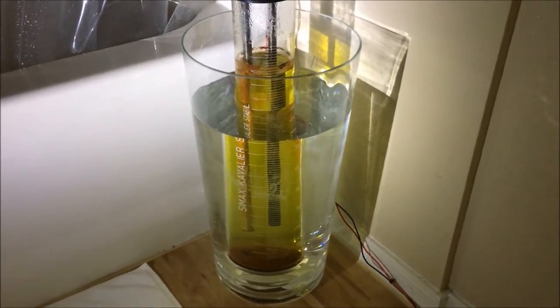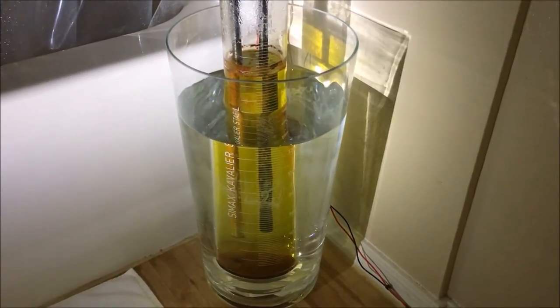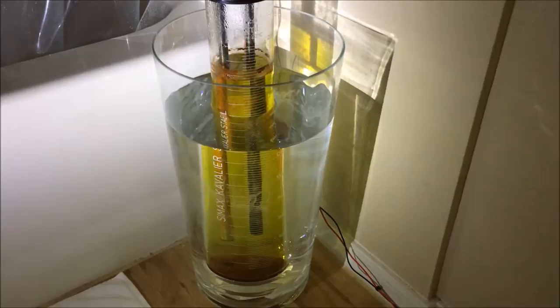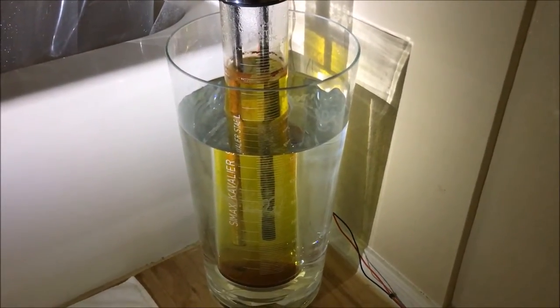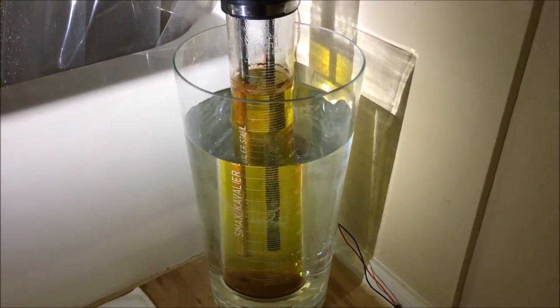So what I'm going to end up having to do is evaporate down this solution into a concentrate and take it to a hazardous waste recycling center where they can either recover the chromium from it or simply encapsulate it and then take it to a safe storage location.